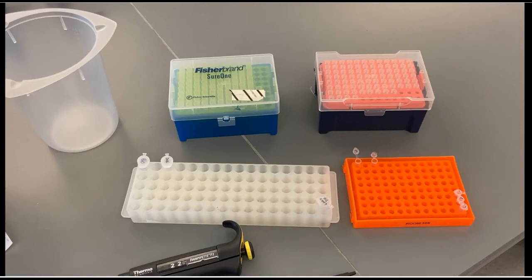In this video, Tim Hastings, our lab tech and also a biology student alum from Keene State, is going to show you what you need to have in your bench area in order to set up the 16S PCR.